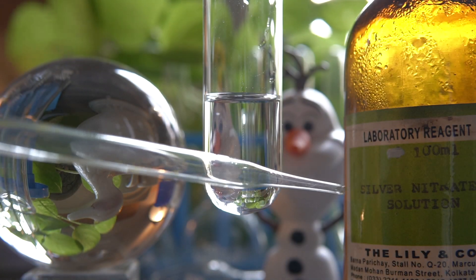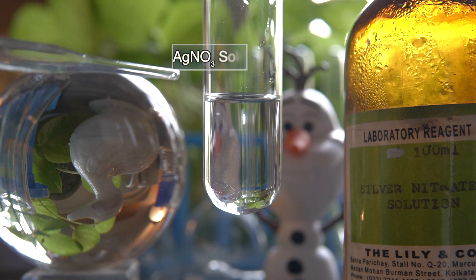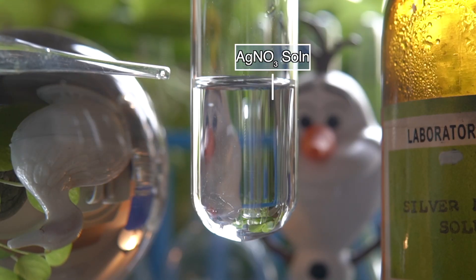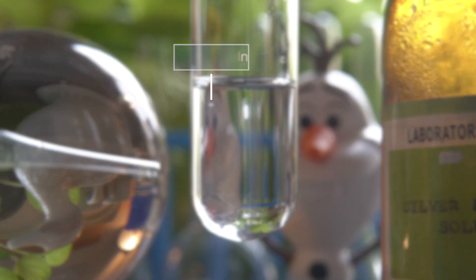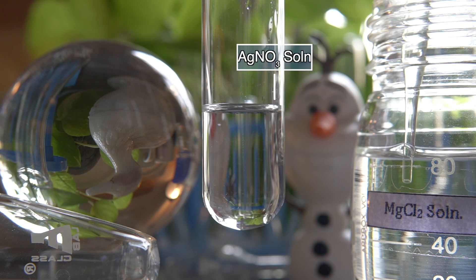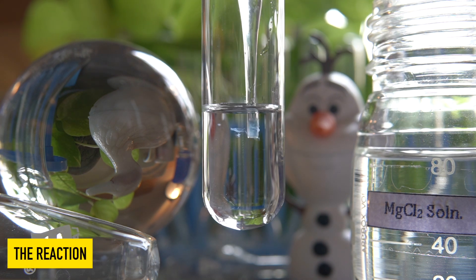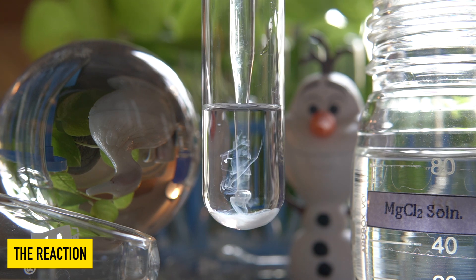Now to initiate the chemical reaction, we will take some amount of silver nitrate solution into this test tube. Now we will add magnesium chloride solution slowly into the silver nitrate solution and observe the effect.